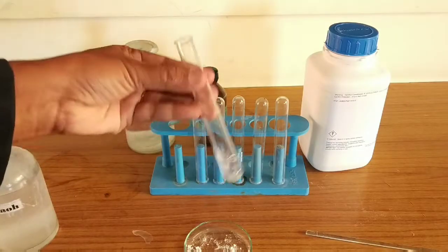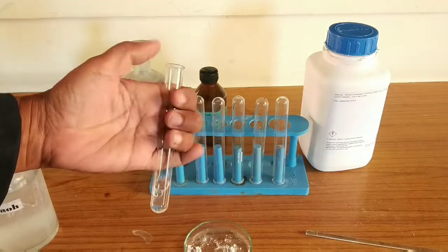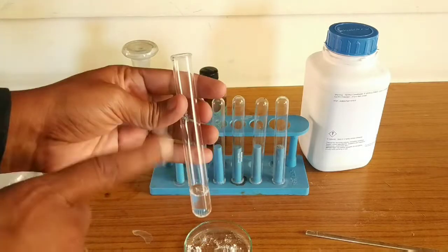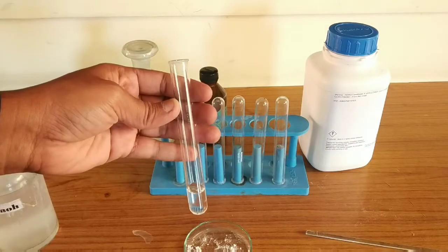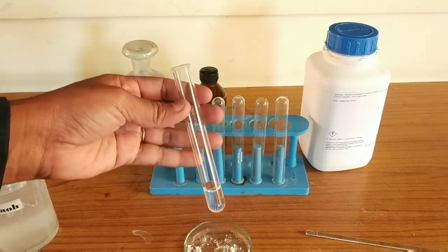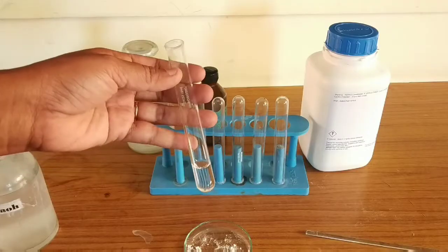We mix the salt properly with NaOH — since it is only a base, you can keep your finger over the test tube and vigorously shake it. After shaking, when you smell it, you will get the smell of ammonia. The smell is similar to what comes from the NH4OH bottle, or in daily life, the smell from public urinals — that is also the smell of ammonia gas.